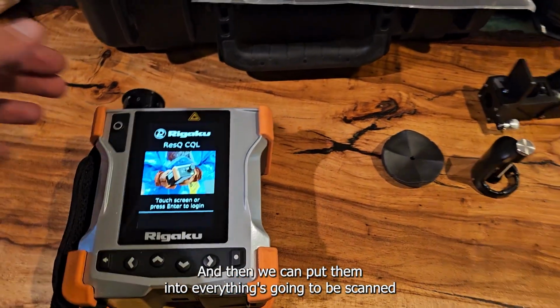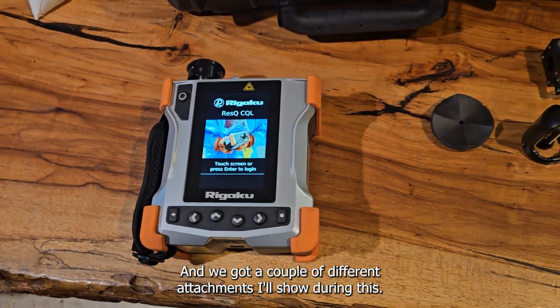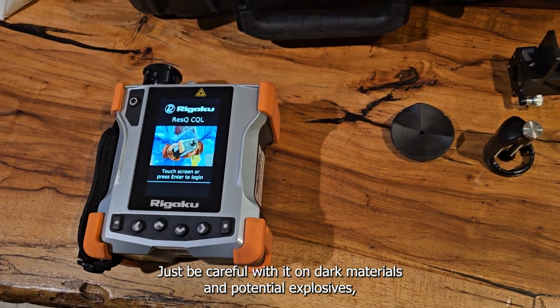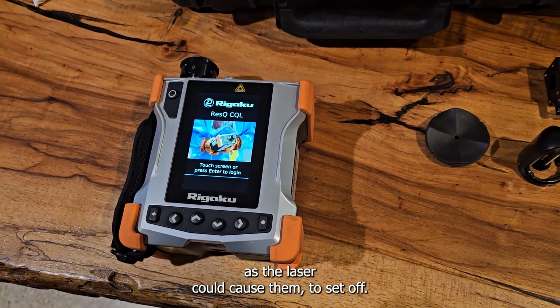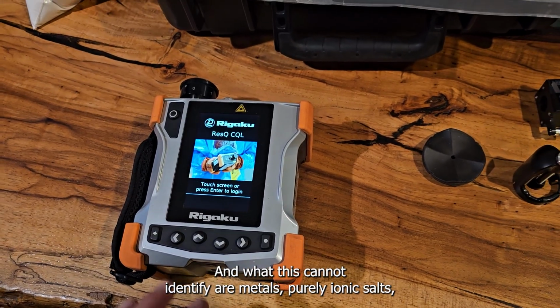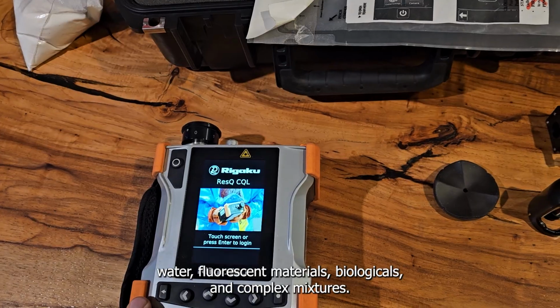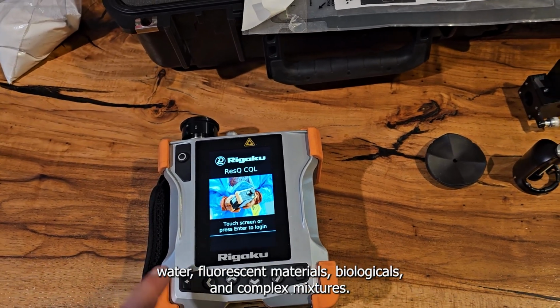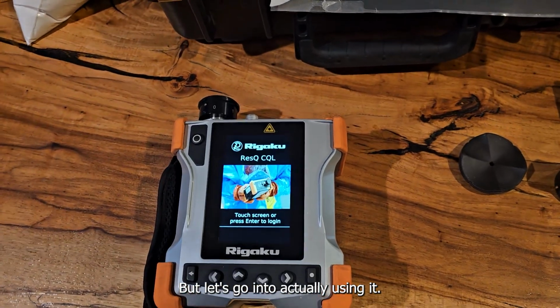And then we could put the material, everything's going to be scanned off this part right here, and we've got a couple of different attachments I'll show during this. Just be careful with it on dark materials and potential explosives, as the laser could cause them to set off. And what this cannot identify are metals, purely ionic salts, water, fluorescent materials, biologicals, and complex mixtures. But let's go ahead and start using it.